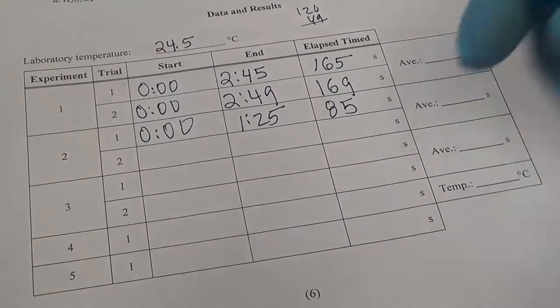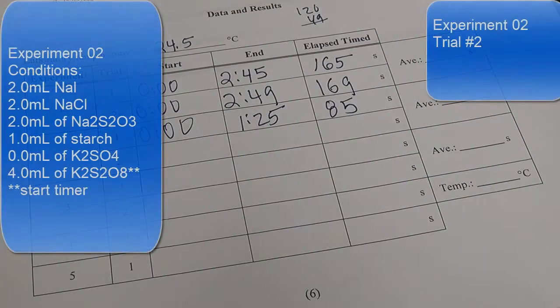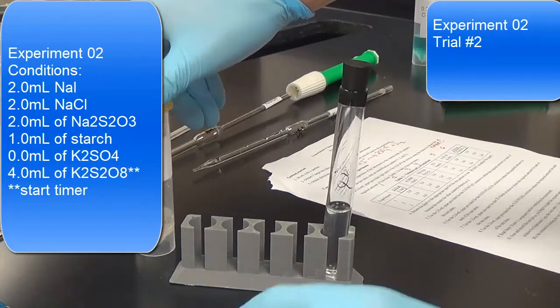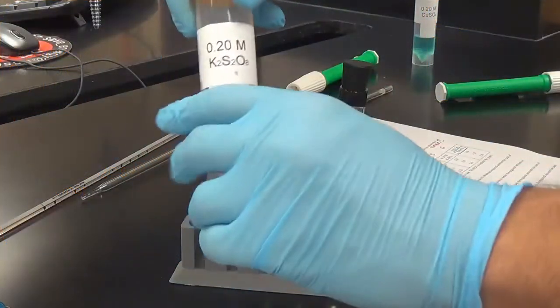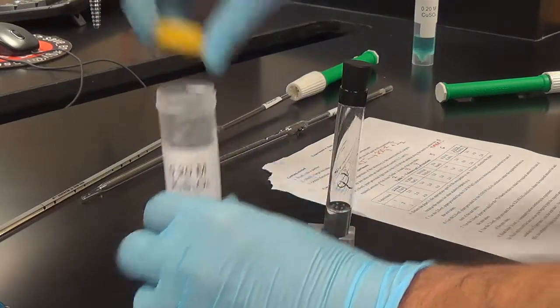All right, trial number 2, experiment 2. All right, here we go, experiment 2, trial number 2, 4 mils of the K2S2O8.